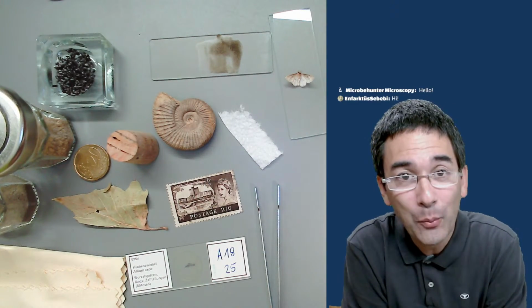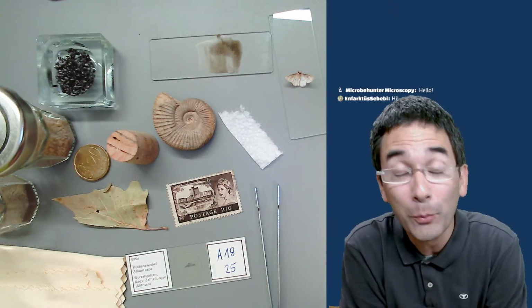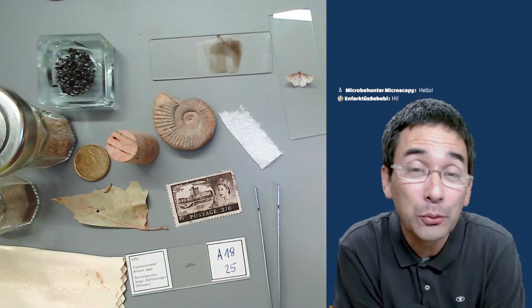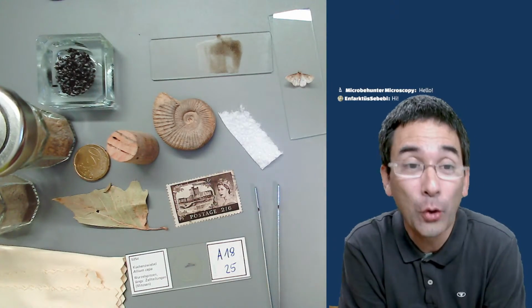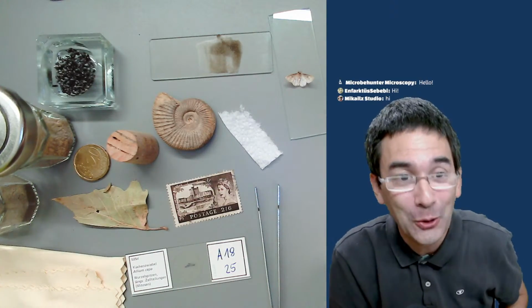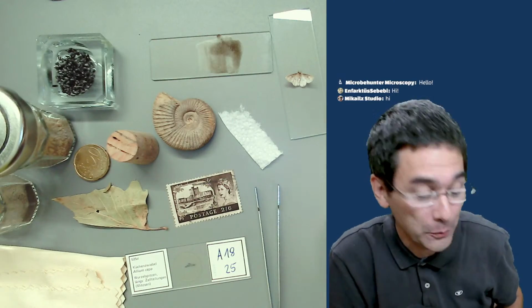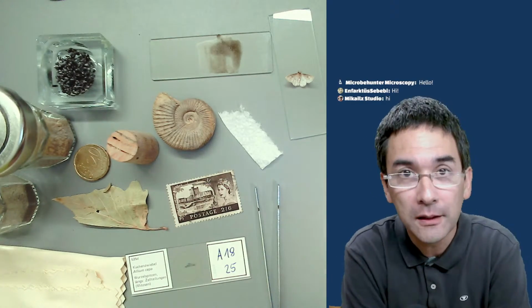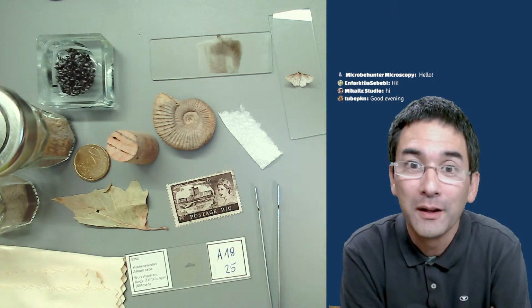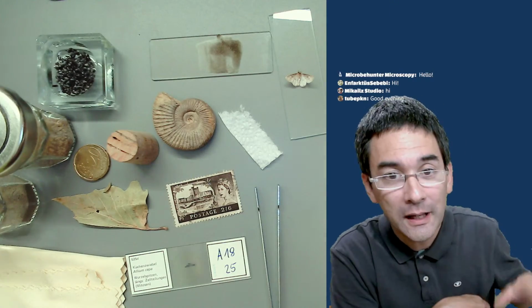Well, today I want to put a few things under the compound microscope, things that you normally probably would not put under the compound microscope because, as you can see over here, they are really not in the correct size and format to be observed. But indeed, today I would like to put them anyway under the microscope with light coming from the top.